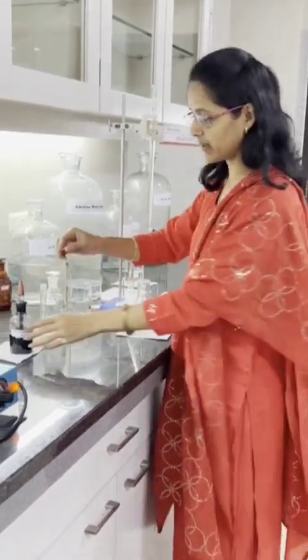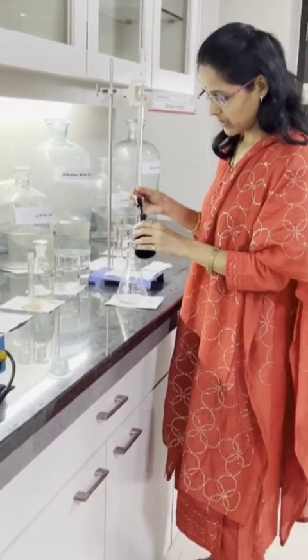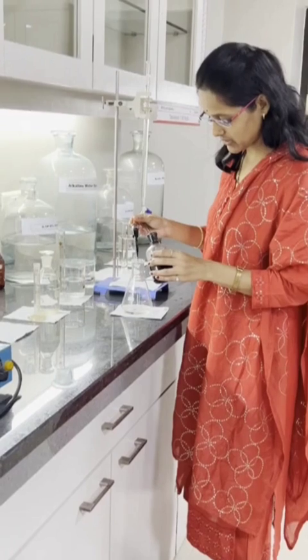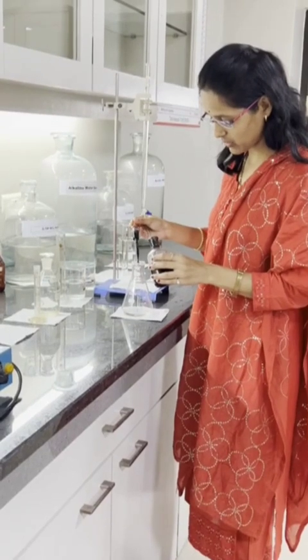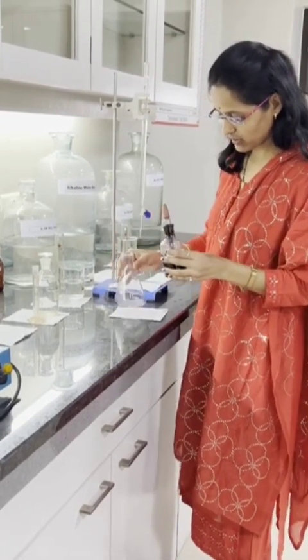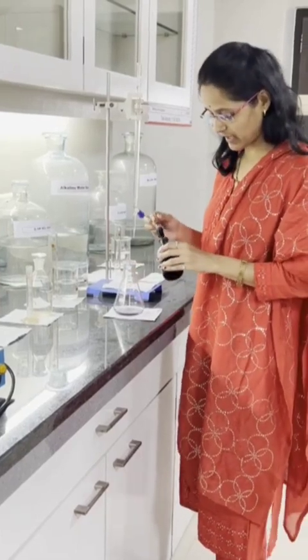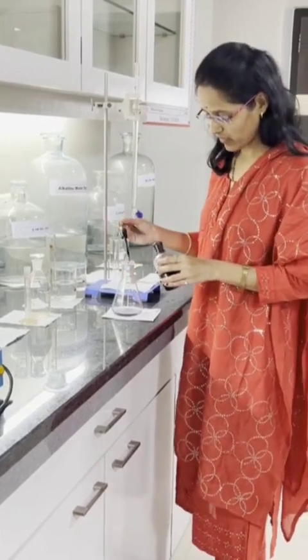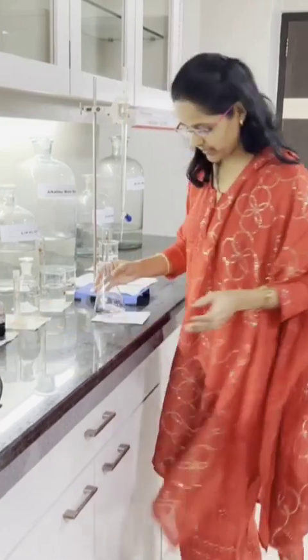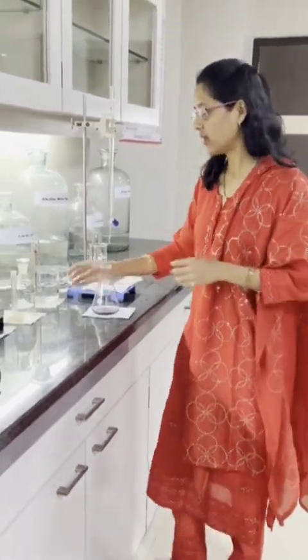Now I am adding the EBT indicator — Eriochrome Black T indicator. EBT indicator is nothing but the Eriochrome Black T indicator. We have to add 2 to 3 drops of EBT indicator. We are getting the wine red color — you can see the wine red color of the sample solution.